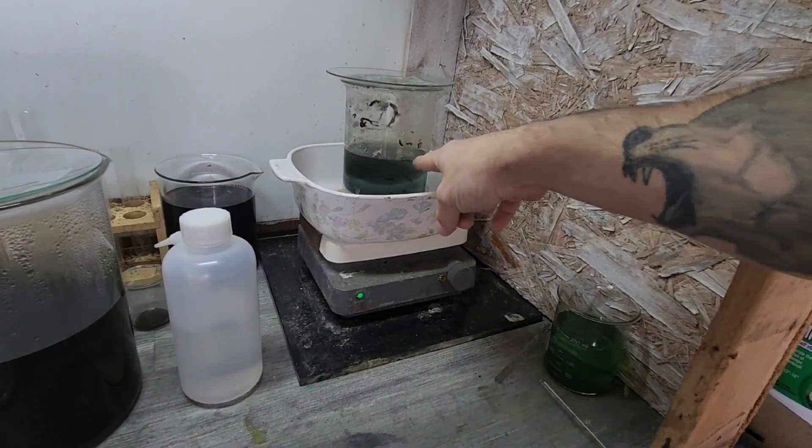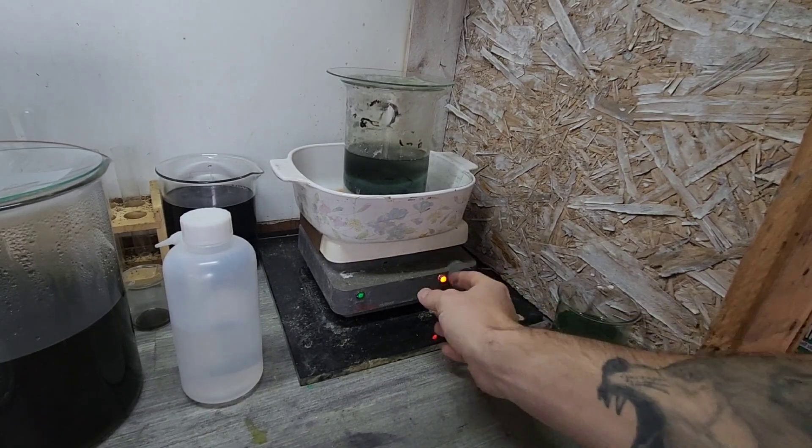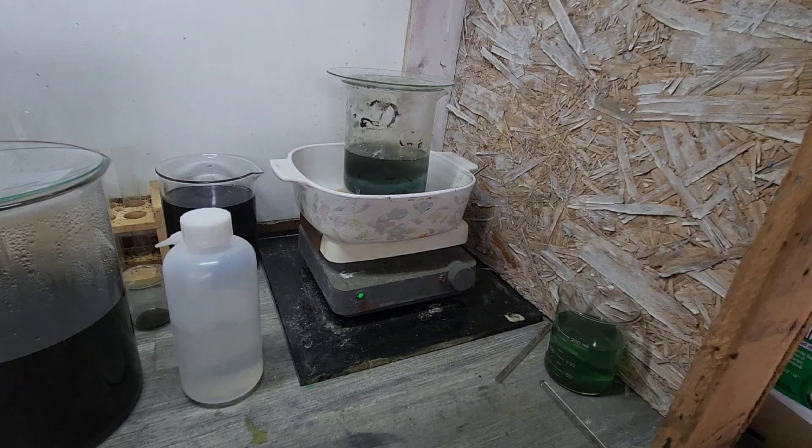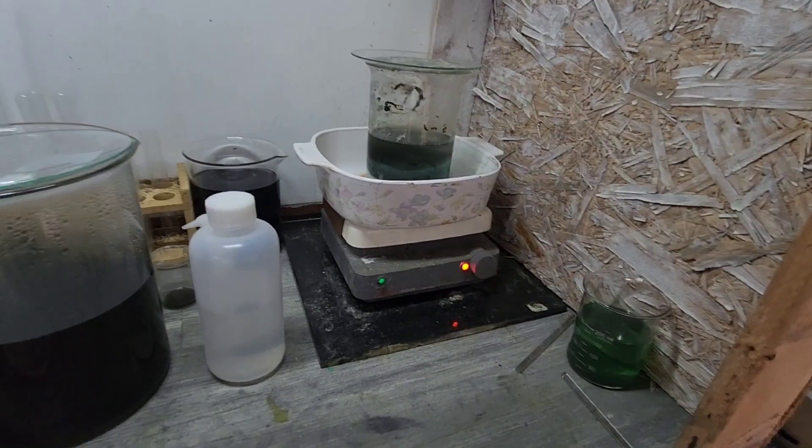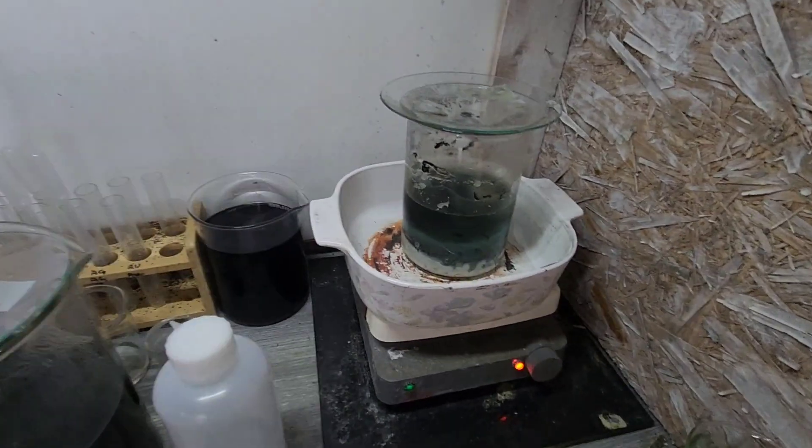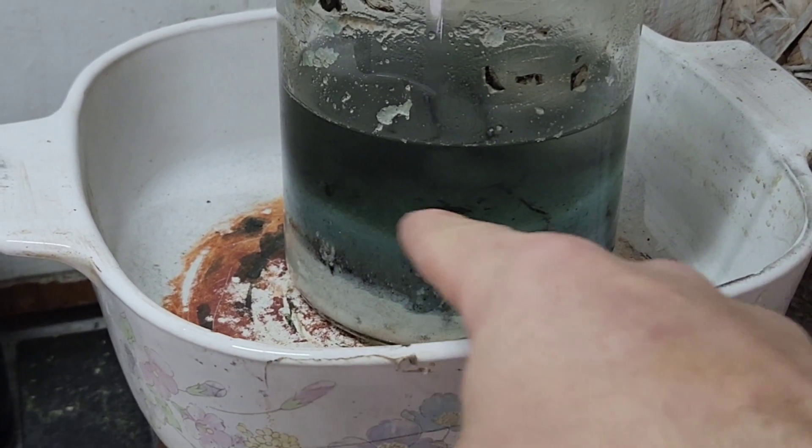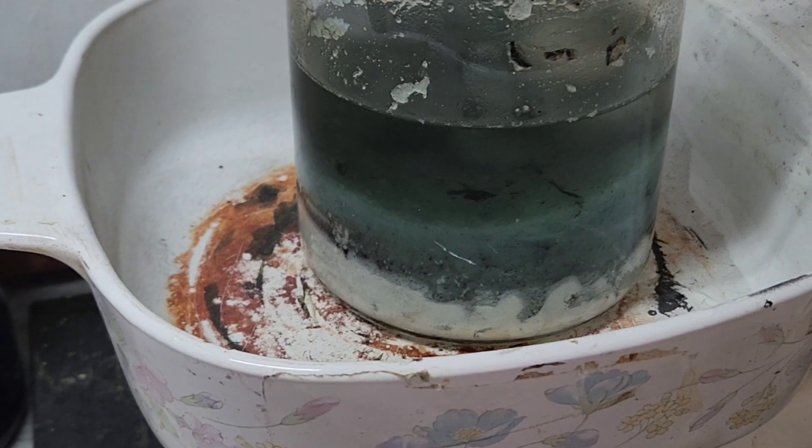So I did put a little bit more distilled water in here to absorb some of those crystals with heat. It's a little higher than I would normally have it. I typically have it like three and a half, we're set to four right now. So we've got a pretty good base. You can see the separation here, so we've got the base of crystals, so that's what I want. And then we've got some other kind of sulfate there on the bottom.